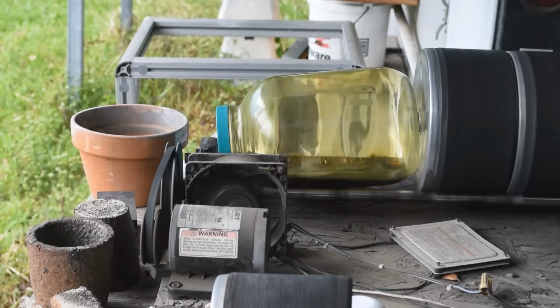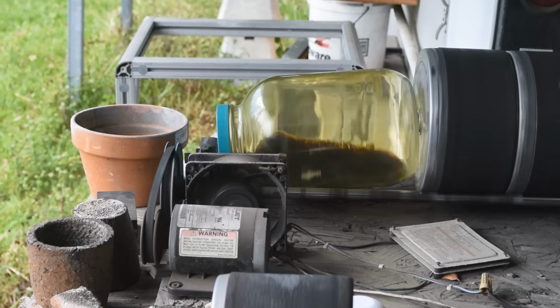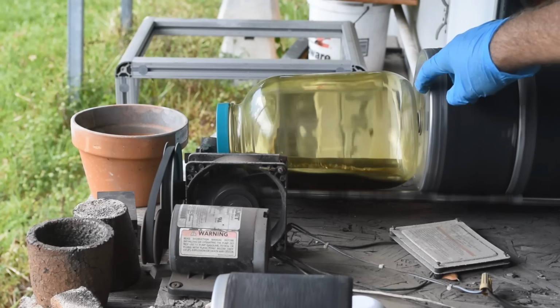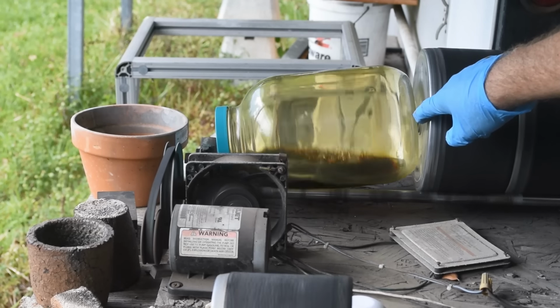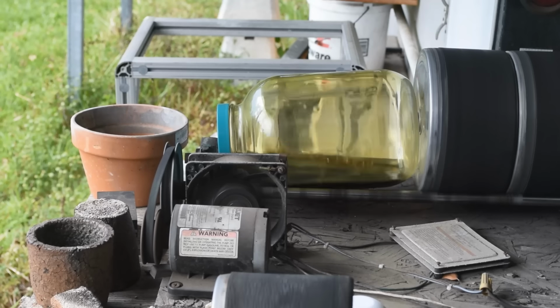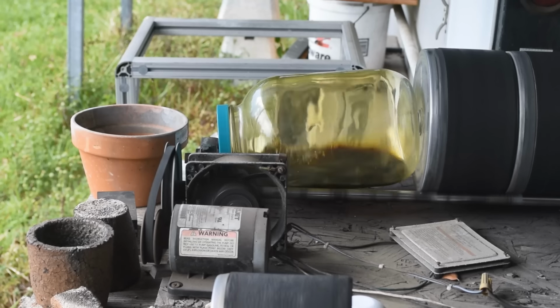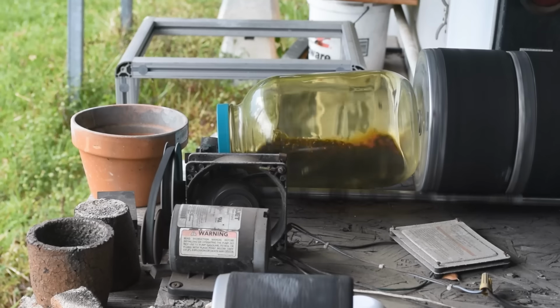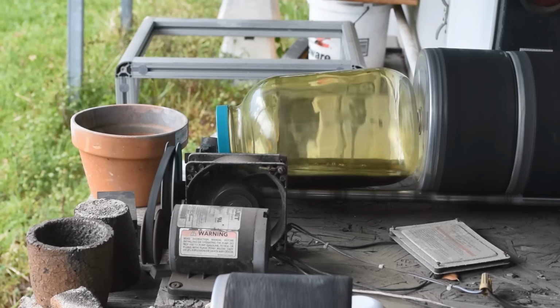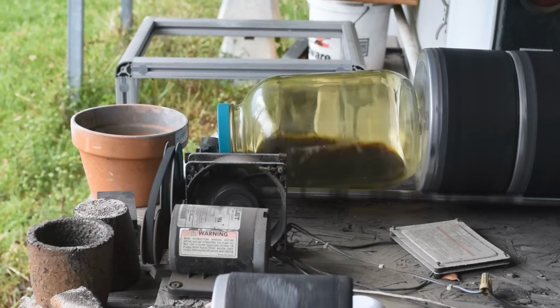Well, after a few minutes, I see we've got an interesting development here. The knob on the end of this tumbler has worked its way into the indentation on the bottom of the bottle, and well, suddenly we're getting a whole lot more agitation. So I was thinking that was going to be a problem, but now I'm looking at it, it's like, no, that's great. That's absolutely fantastic. We're getting even more agitation than I thought. So I don't think there's any way we're not getting enough agitation.